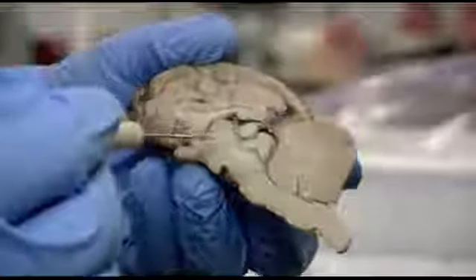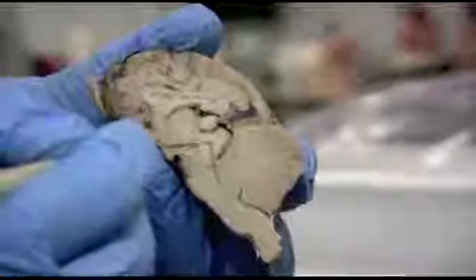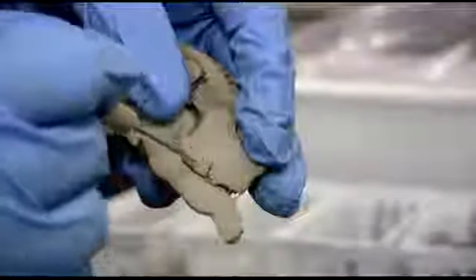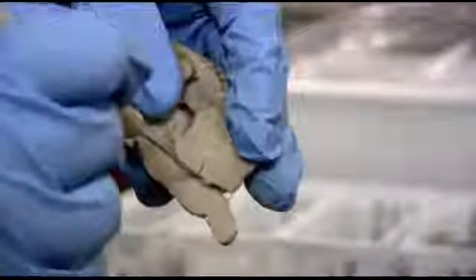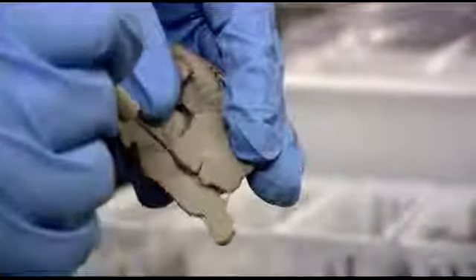The aqueduct of the midbrain that connects the third ventricle with the fourth ventricle is actually going to come down around the thalamus. It's going to be this connection right here that you can follow down. As we come down, it's going to go in between the rest of this brainstem and the cerebellum. So the aqueduct of the midbrain is this canal, and it's going to empty into this fourth ventricle, which is right here in this indent of the cerebellum. So it's right in the middle of the cerebellum that it indents, and the emptying of that canal is a more wide open space. That's the fourth ventricle.